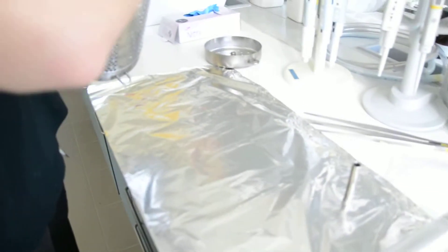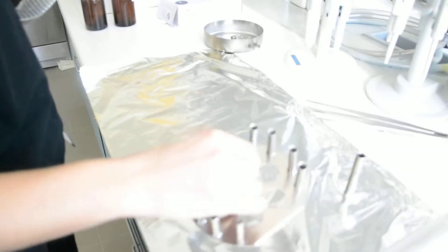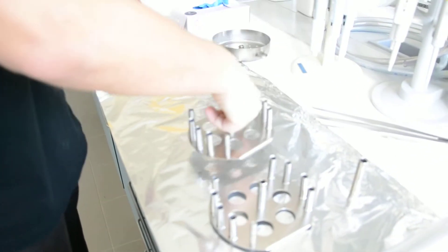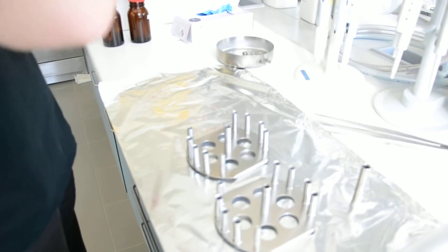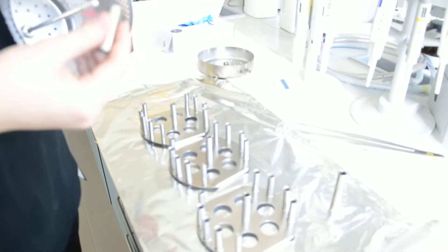Inside of the cage there is first some iron tube and then three of these things, it's called a spider. And then some other tube we can leave it there.